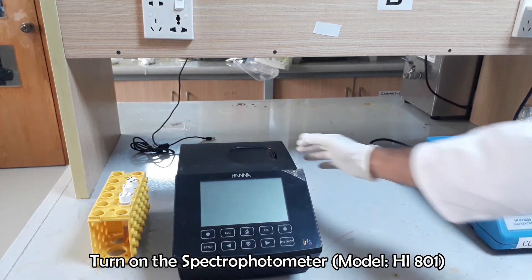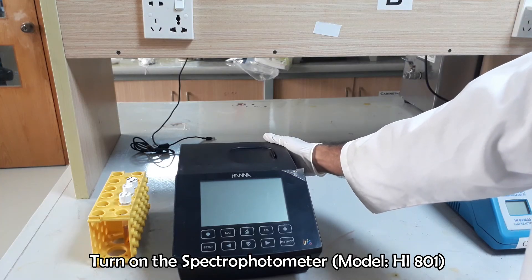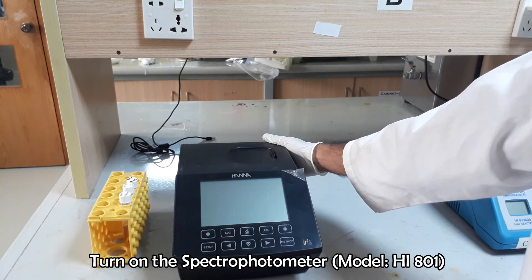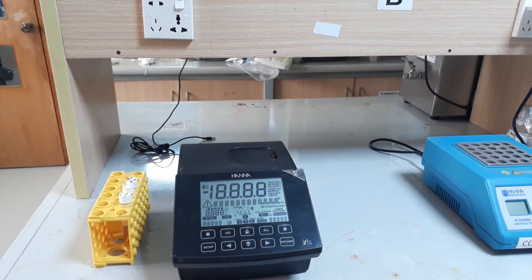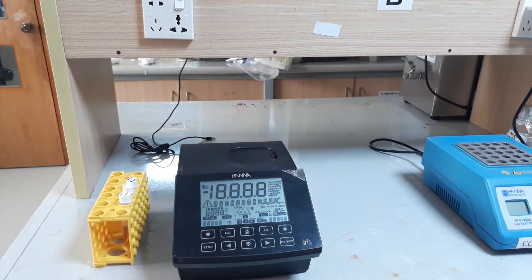Now we are in the last step. Turn on the power of the spectrophotometer and wait a few moments, allowing the instrument to adjust its functions and calibration.